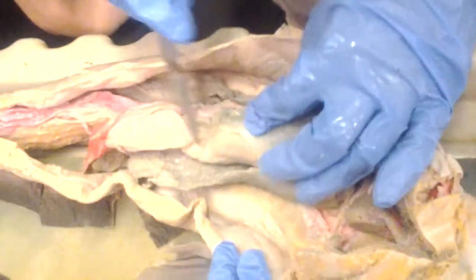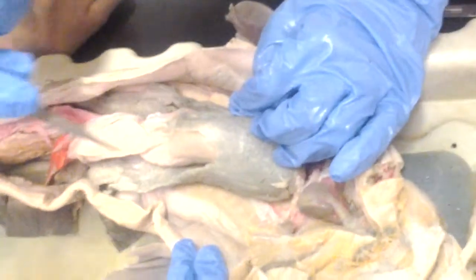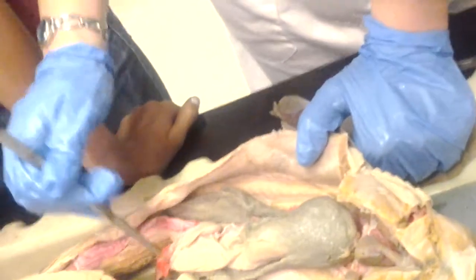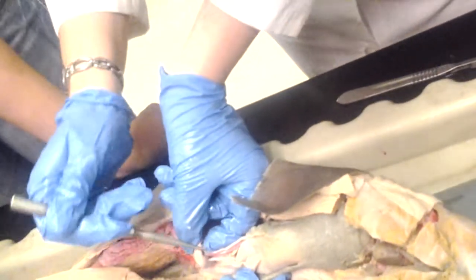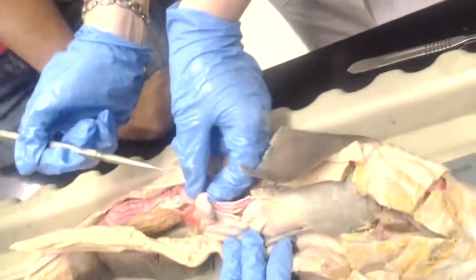Now, what is this? That's the cardiac stomach, right? The cardiac region is really up here. This is the body of the stomach. This is the pyloric region, right? The pyloric region of the stomach is where it bends up like a letter J. And then you have the pylorus right at the very tip. That's the sphincter, the pyloric sphincter.